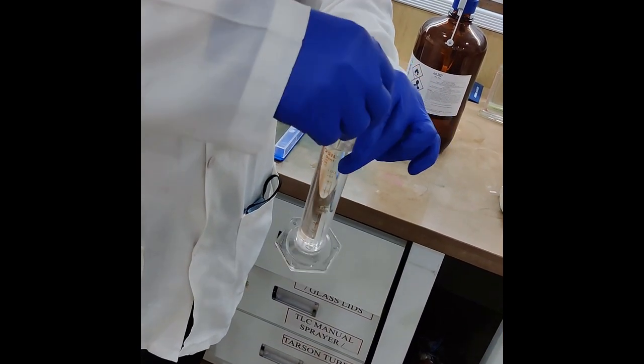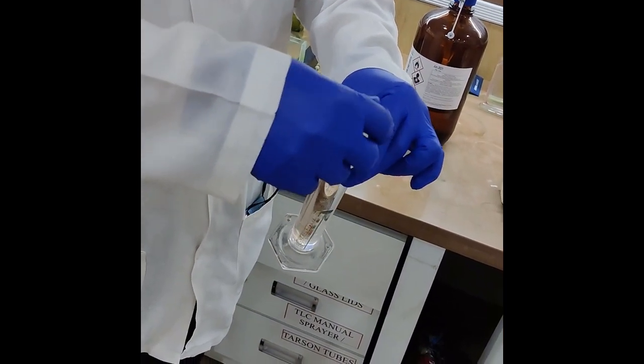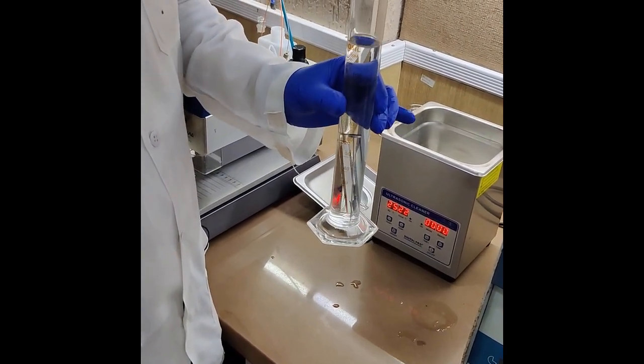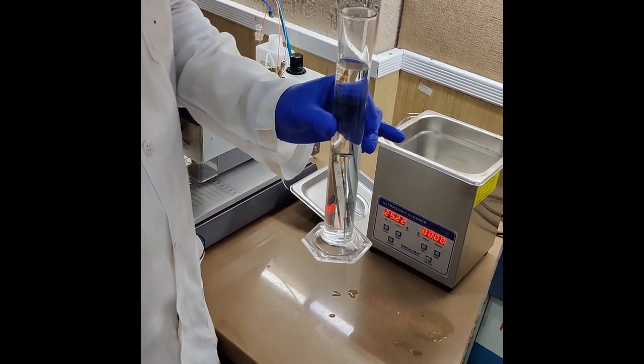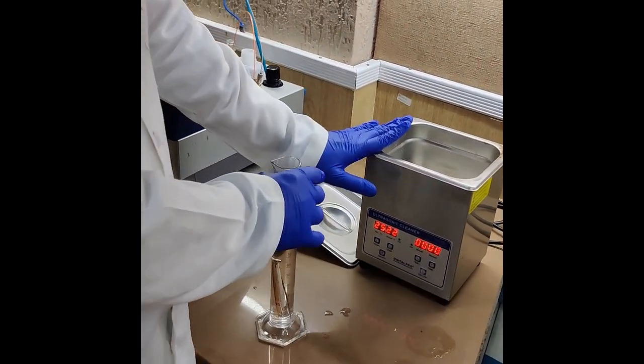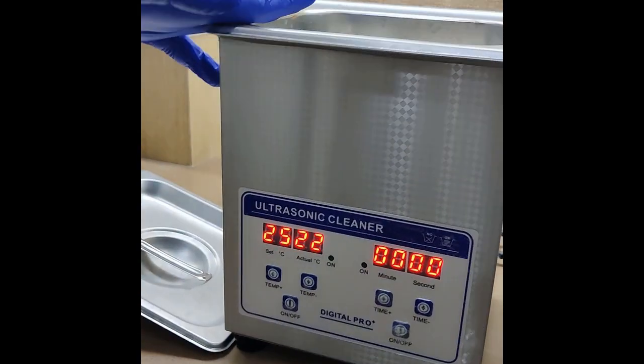The process is now ready for sonication. After we have made this arrangement, the next step is to sonicate for 20 minutes. That can be done by simply using a sonicator at your facility.